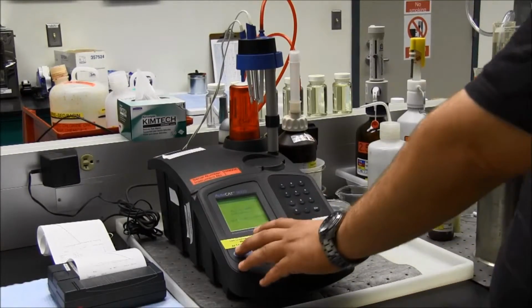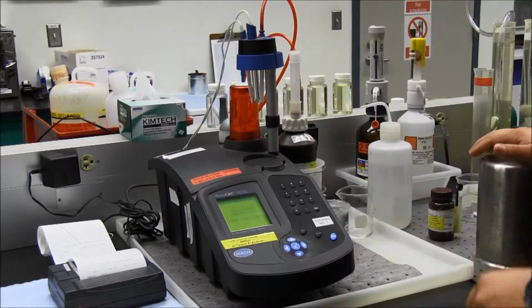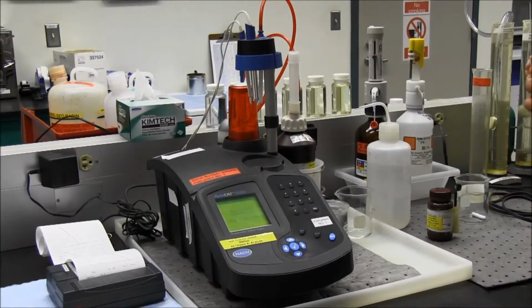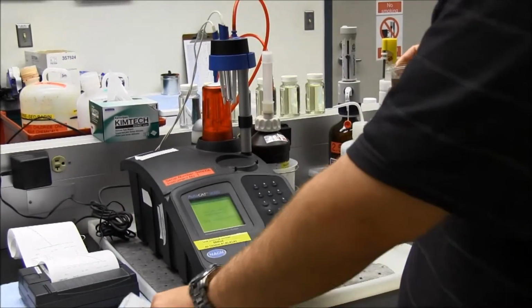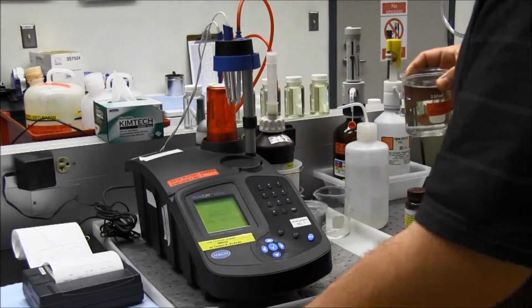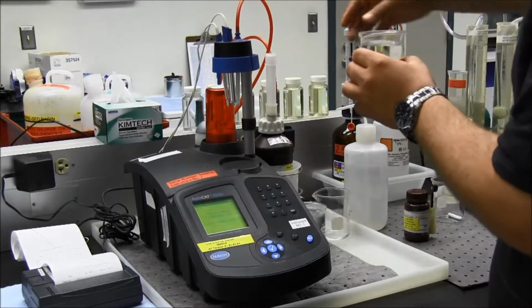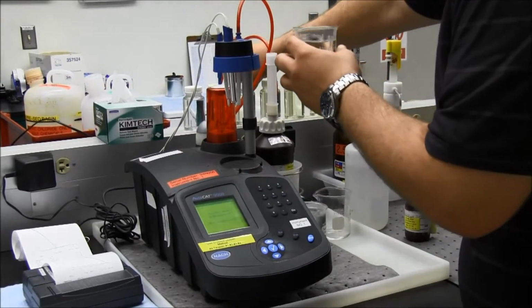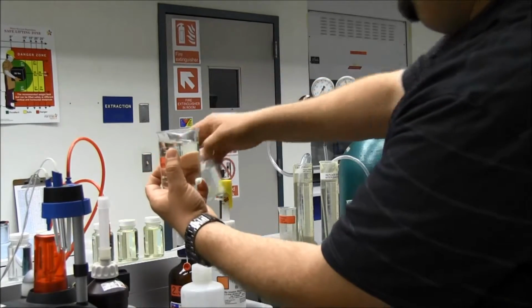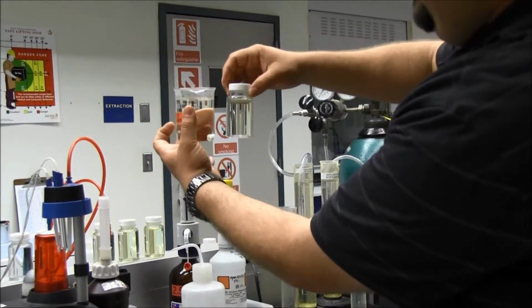So now my 5 minutes is over. Now it says place sample on the instrument and dip electrode in sample. So I'll take my sample. Now we're going to have to pre-dose and pick our increment on this one also. From my chart, it says for the second titration, I'm going to use my standards up here to compare. I have my different colors up here. So I think this one has about the right tint.